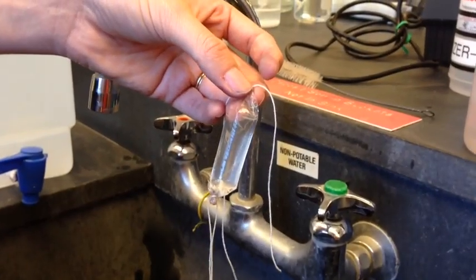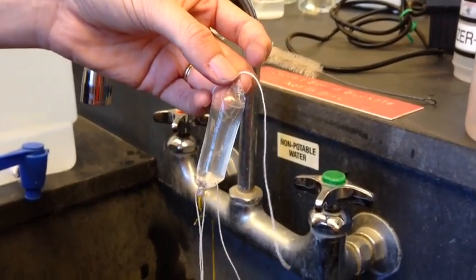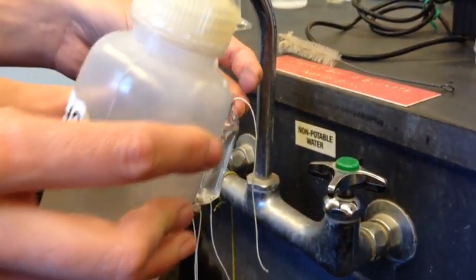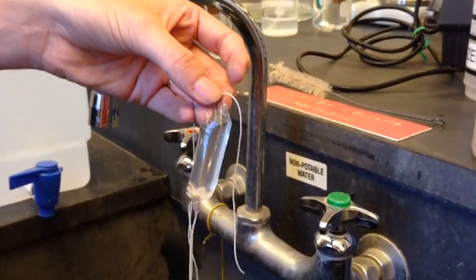It's really important that the stock solution is only inside the bag and not on the outside. If you've spilled any, give it a quick rinse with DI water so there's no stock solution on the outside.